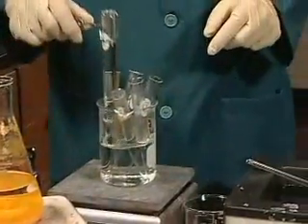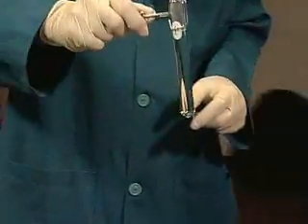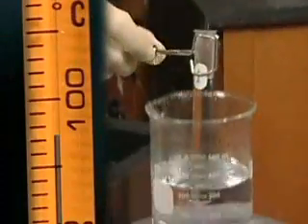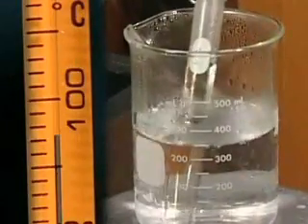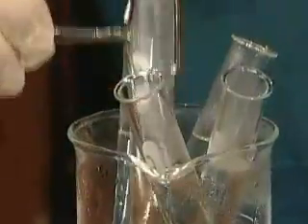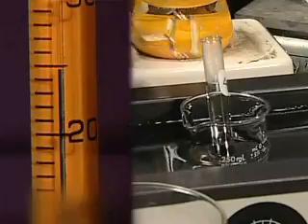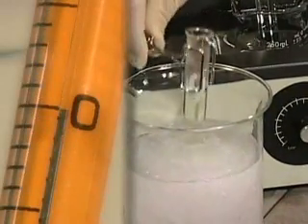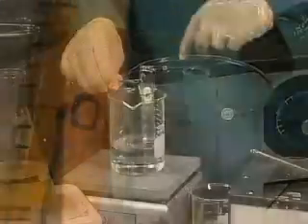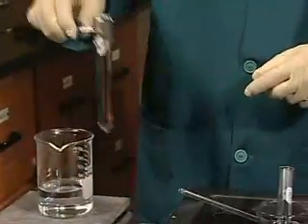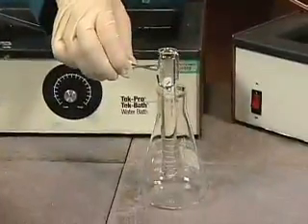One sample of the hot-saturated solution is placed in a boiling water bath that remains at 97 degrees Celsius. Three are placed in constant temperature water baths at 70 degrees Celsius, 50 degrees Celsius, and 25 degrees Celsius, respectively. Another sample is placed in an ice water bath at 0 degrees Celsius. A sixth sample is allowed to slowly change temperature to room temperature.